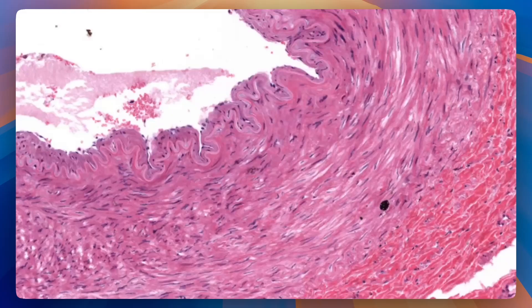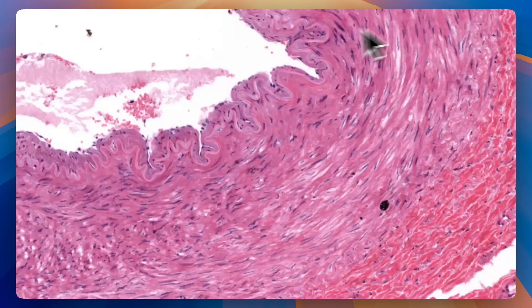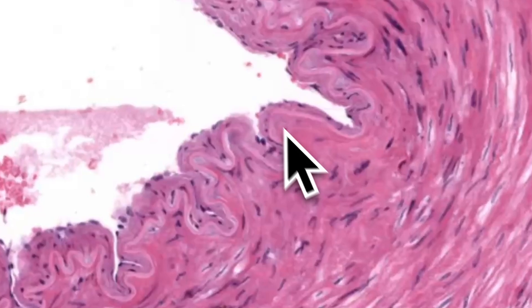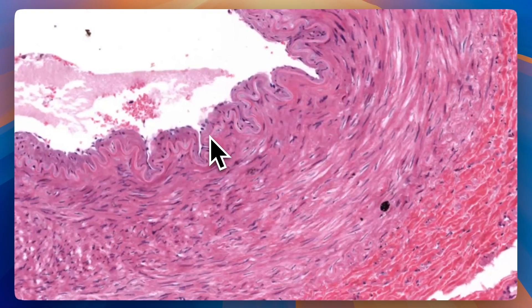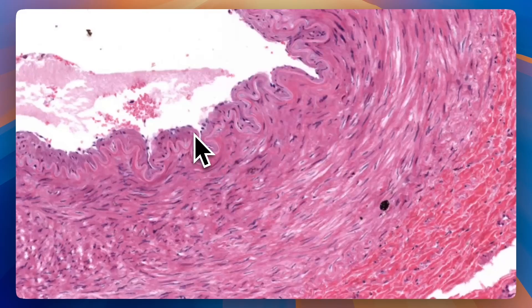Today we're going to talk about muscular versus elastic arteries. It's going to be quick since it's very simple. Basically it's all about the elastic laminae — these lasagna noodle-like structures you might find in your slide. We borrow the term lamina from Latin; it means plate or layer. So you're basically looking for a layer of elastic fibers.